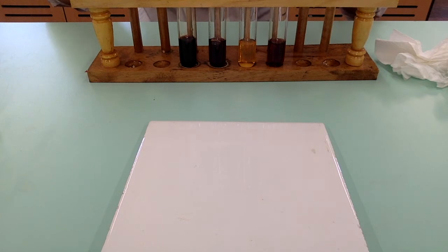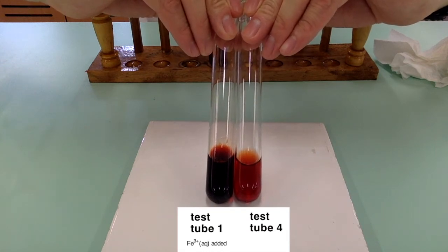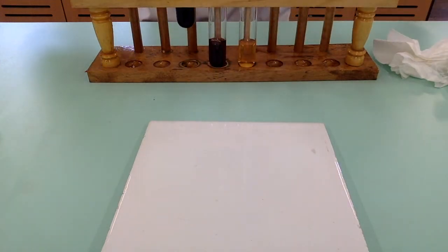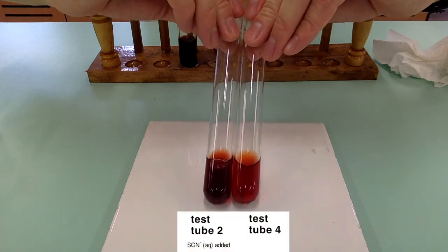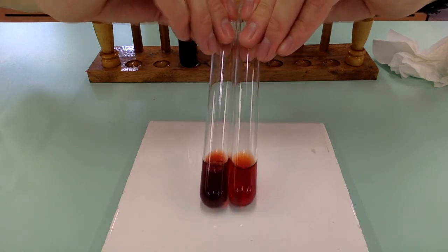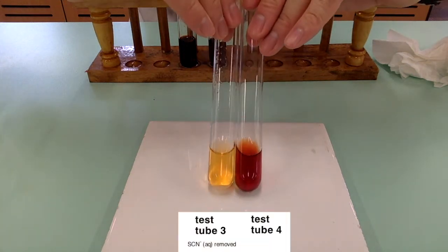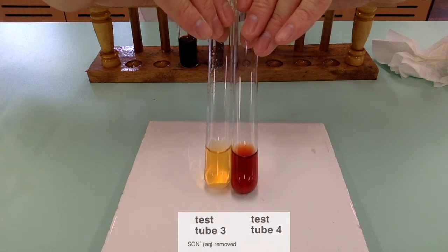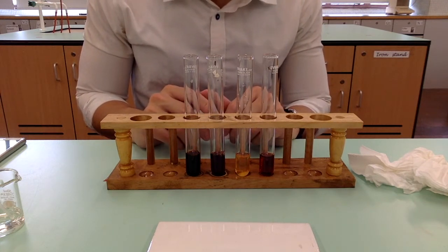We will compare test tube number one with test tube number four. It is obvious that test tube number one has a deeper red color than test tube number four. We are now going to compare test tube number two and test tube number four. Again, test tube number two is having a deeper color than test tube number four. Now we will compare test tube number three and test tube number four. It is obvious that test tube number three is much lighter than test tube number four. You should record the color changes as the observation on the table on page three of your workbook.